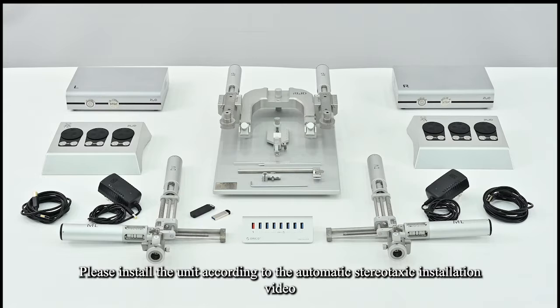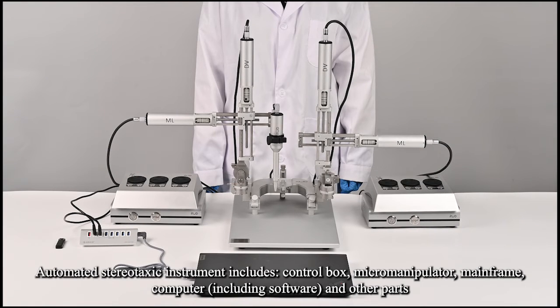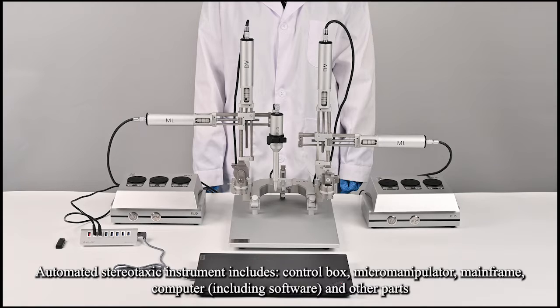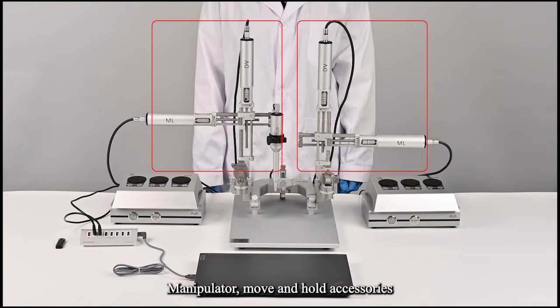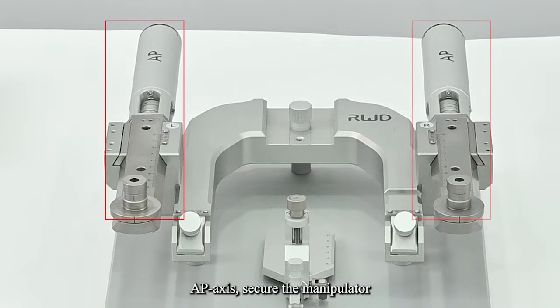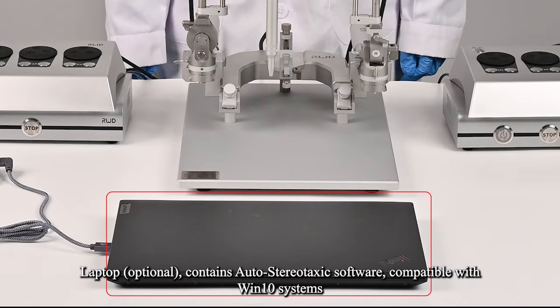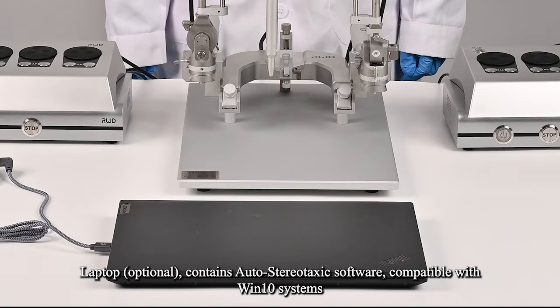Please install the unit according to the Automatic Stereotaxic installation video. The Automated Stereotaxic instrument includes a control box, micromanipulator, mainframe, computer including software, and other parts. The manipulator moves and holds accessories along the AP-axis, secures the manipulator, and has a U-shaped base to secure the animal adapter and ear bars. An optional laptop contains the auto-stereotaxic software, compatible with Windows 10 systems.